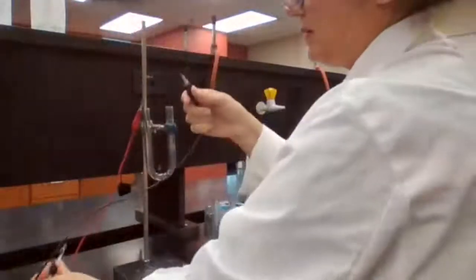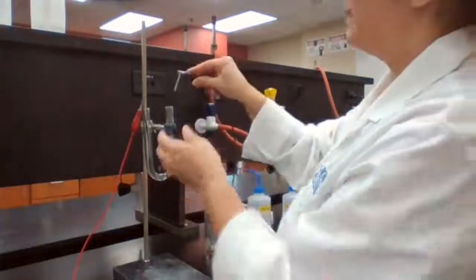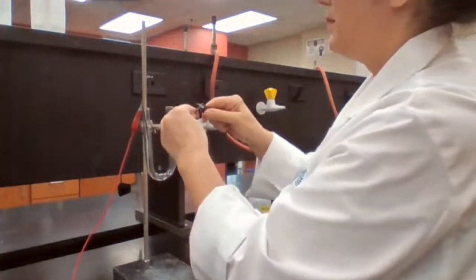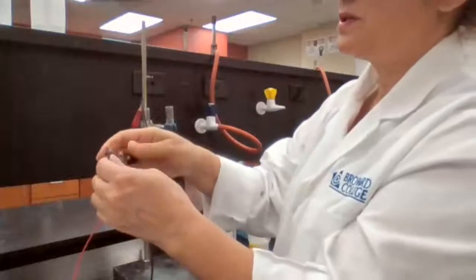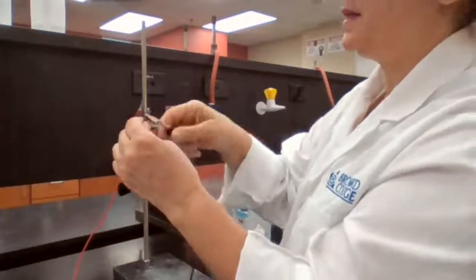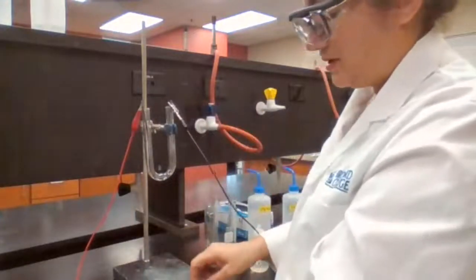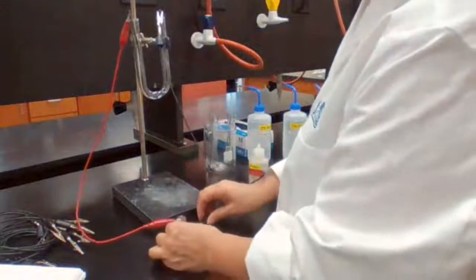And the other one, I take a different clip, and one side stays in the cell. Usually when we have too many students here, we don't have much of a choice. We have to deal with it, but now I have plenty, and it's only me here. And then the other side is going to be attached to the battery. So you see, it's a very simple setup of the electrolytic cell, and I need to connect it.